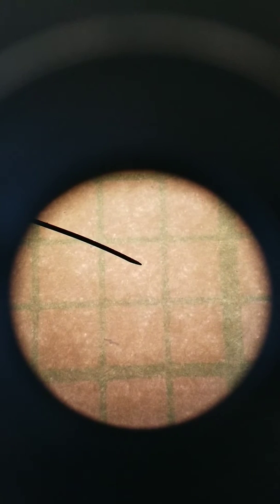I also have to have a quick disclaimer here. Because I'm using a phone camera, it magnifies it a little bit more. If I look through with my own eye without the camera, what I would see is 5 lines across. On this phone camera it's a little less than 5. But count how many squares there are across. There's 1, 2, 3, 4, roughly 5 squares. Like I said, each square is 1 millimeter by 1 millimeter, so the diameter of this field of view is 5 millimeters.